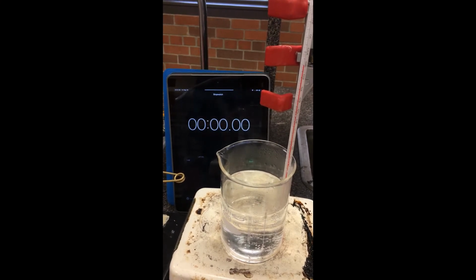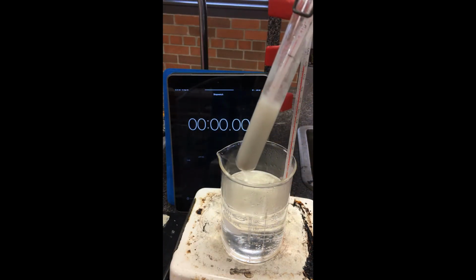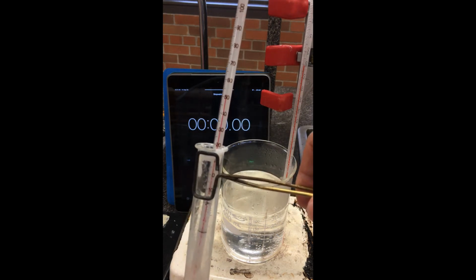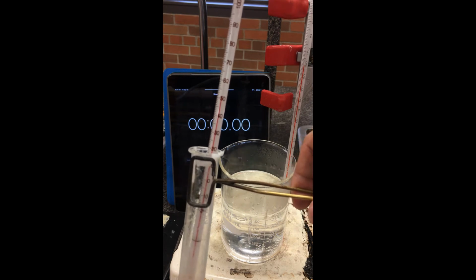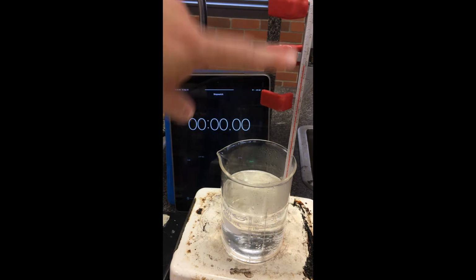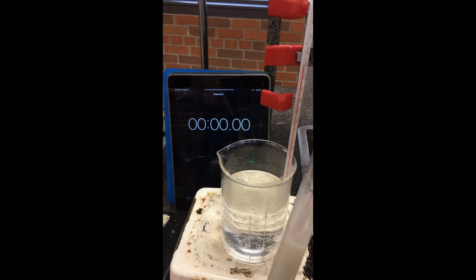Okay, so we're going to do part 2 of this experiment here, which involves a melting point curve. I'm just going to show you what the stearic acid looks like at the moment. Remember, it had been solidified inside this test tube. I don't want to be pulling out the thermometer at this moment for risk of damaging it. Notice that our starting temperature is still roughly about 51, 52 degrees or so. I have sitting in front of me here a hot water bath. We do have a second thermometer here just to read the temperature of the hot water bath. It just needs to be hotter than this one so it can actually melt the stearic acid.